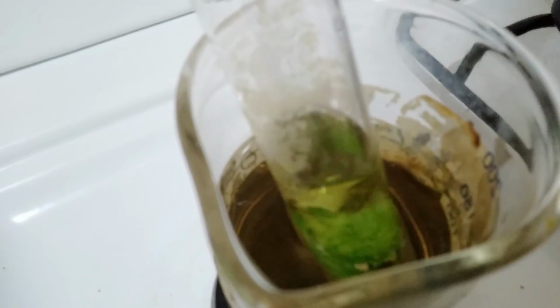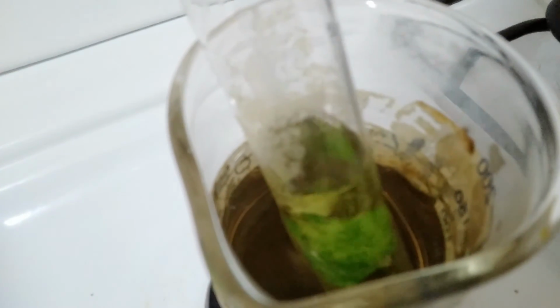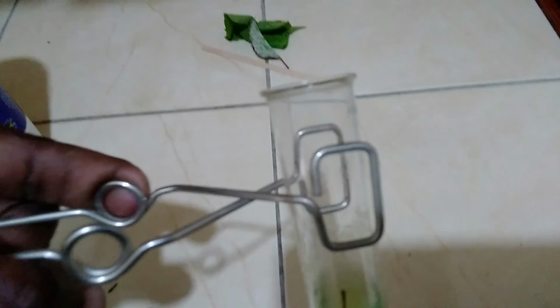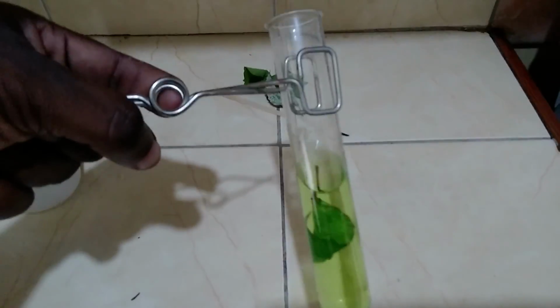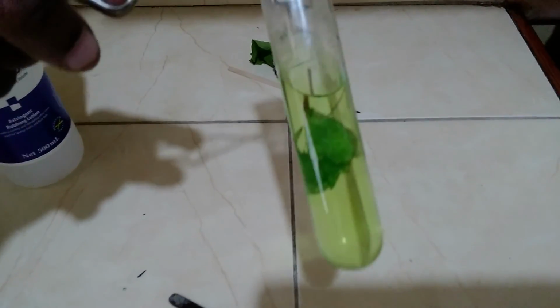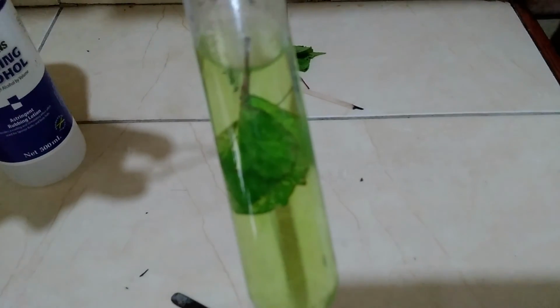Then the next part you want to look at is, why is the alcohol boiling? That's a part of your observation, and for the discussion you are going to explain. You are going to do the why in the discussion. So for safety reasons, I'm holding this away. I'm holding the camera with one hand. Now that's another bit of observation. Look at the color of the alcohol. Can you see? Look at the leaf.